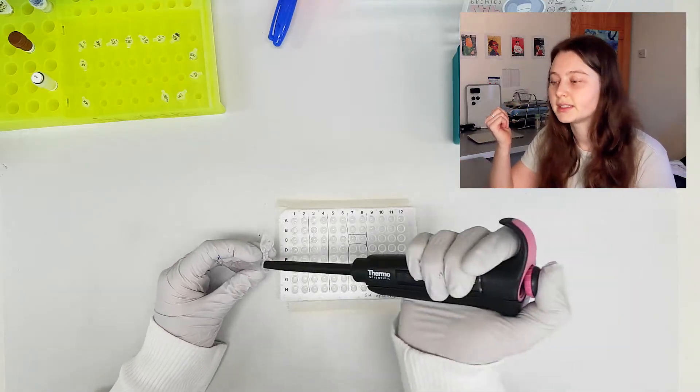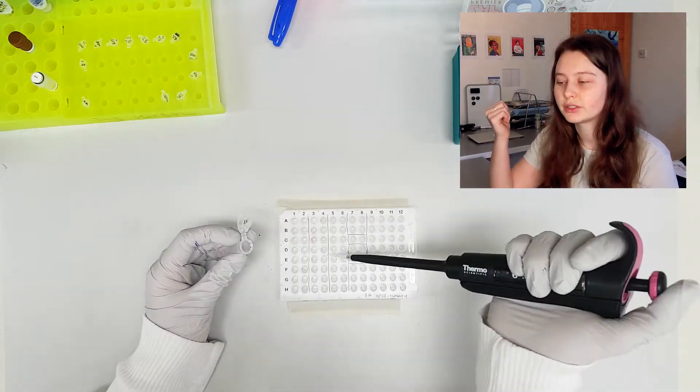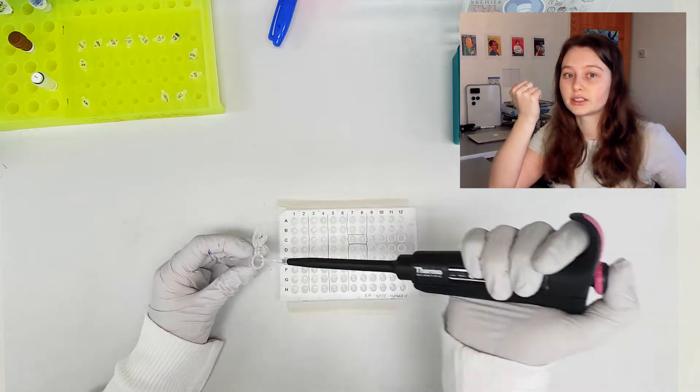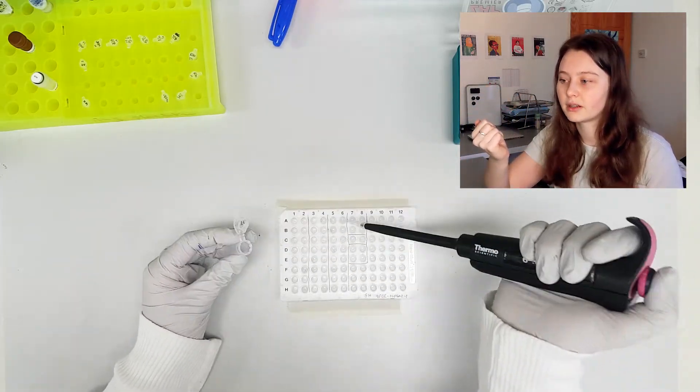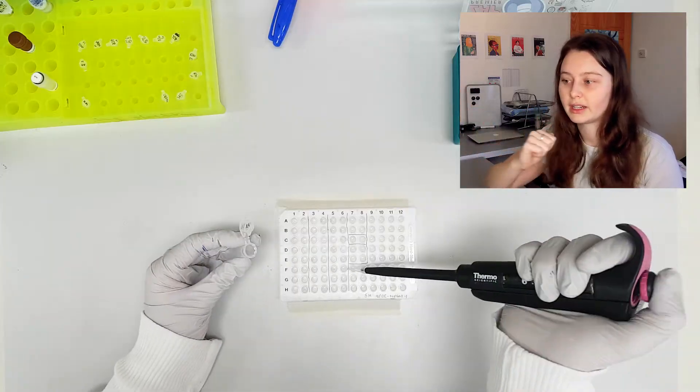So I'm reusing this pipette tip here, but if I was ever to touch the side or touch my own hand or touch the desk or anything that I was worried about, I would just get rid of that tip and keep going.